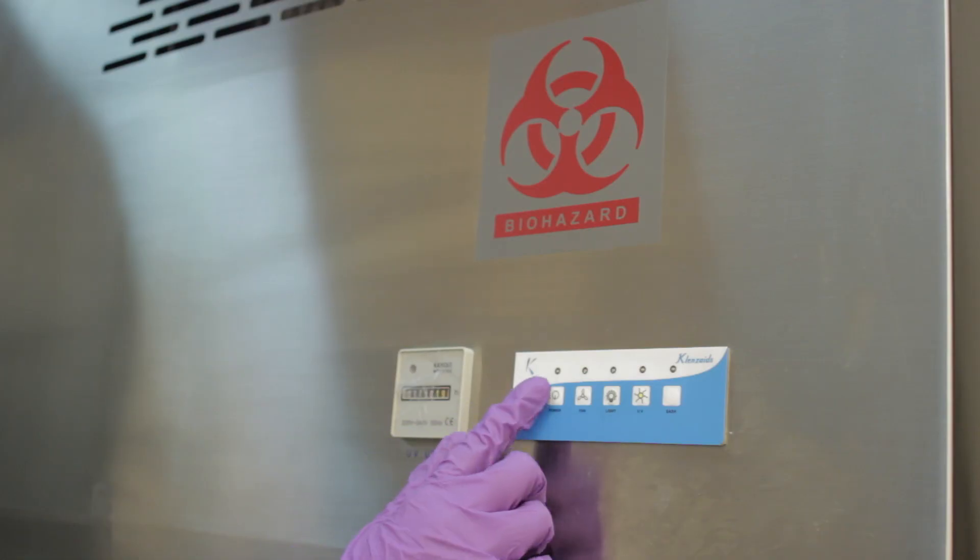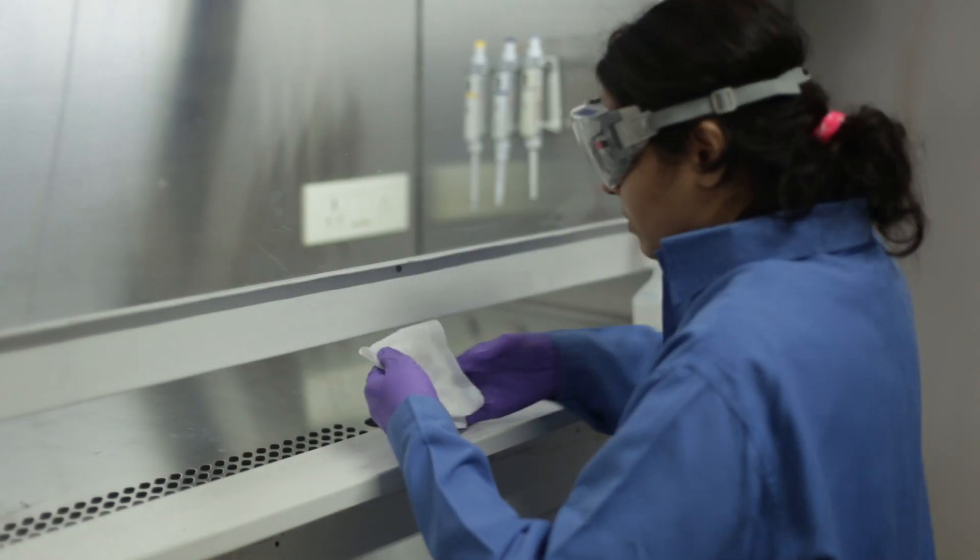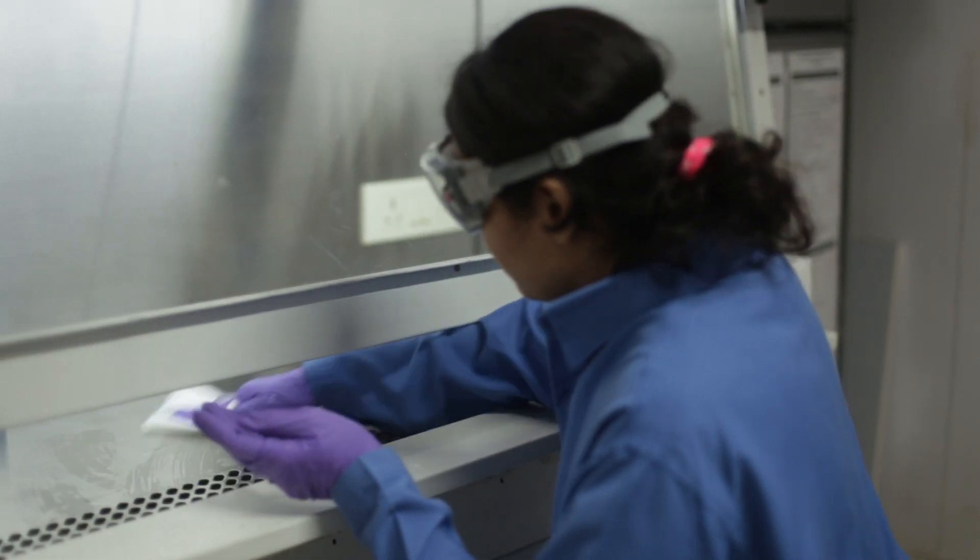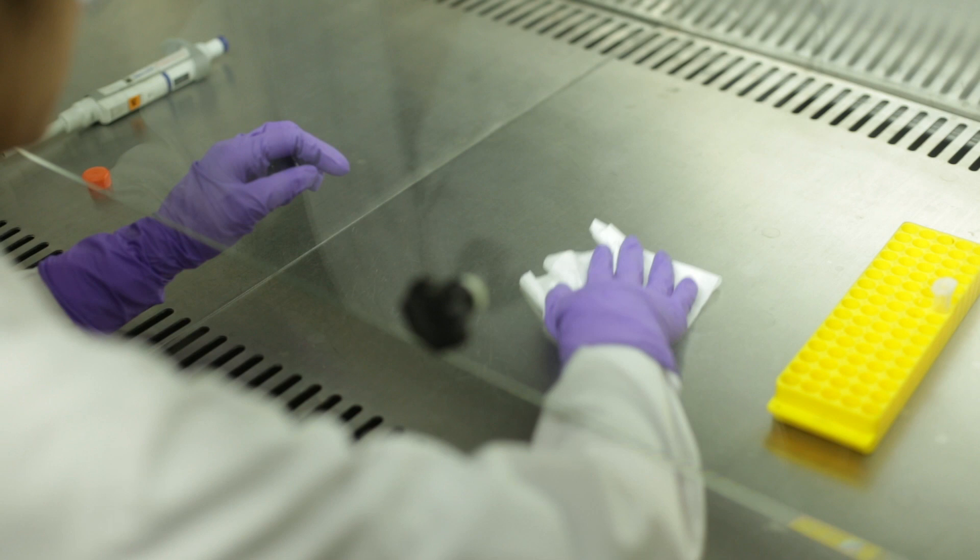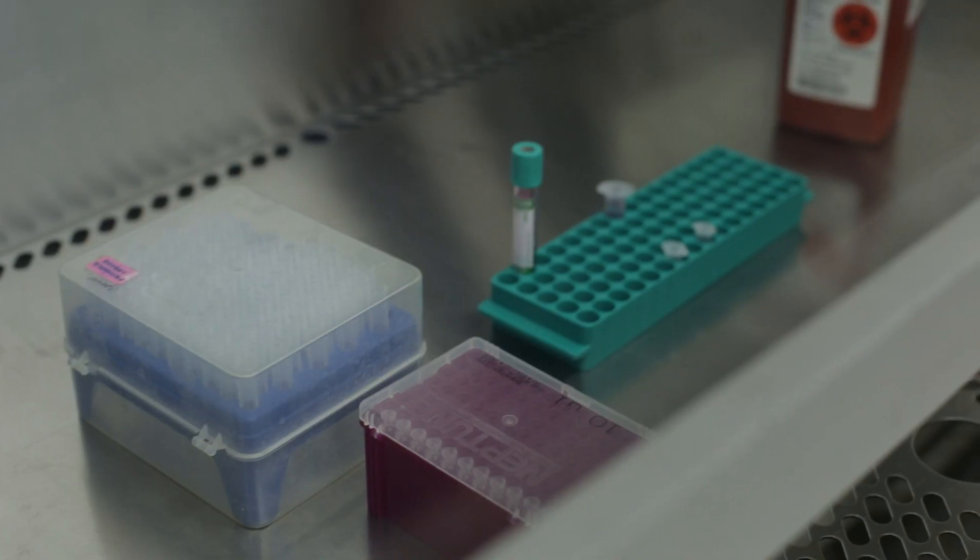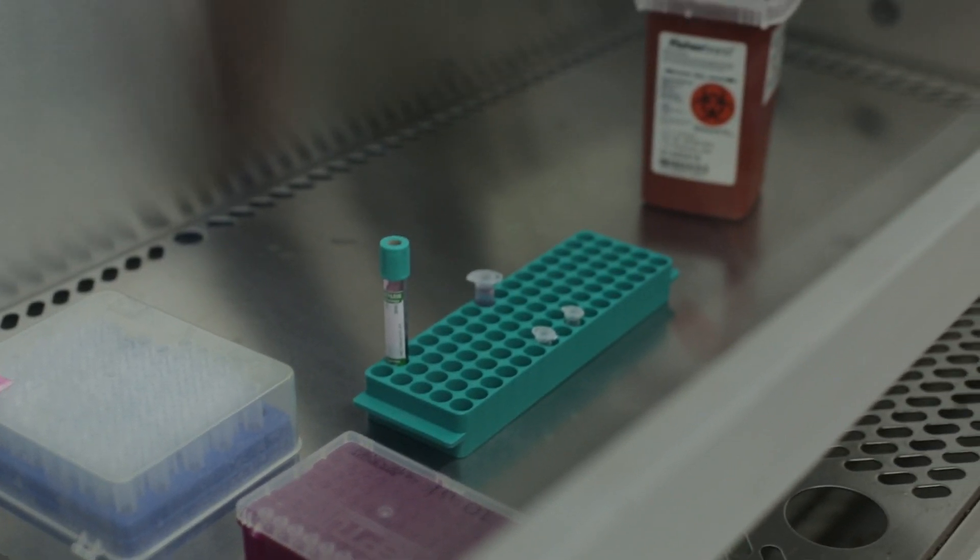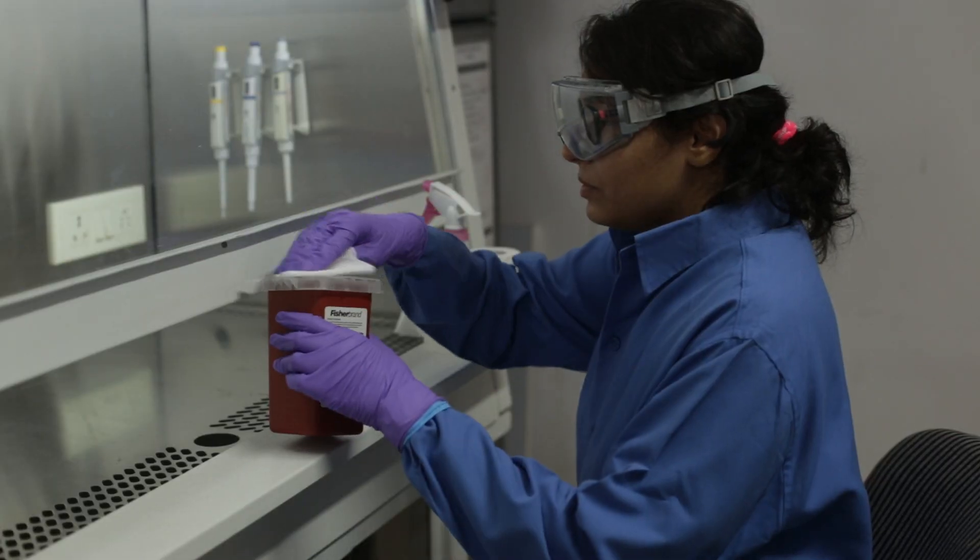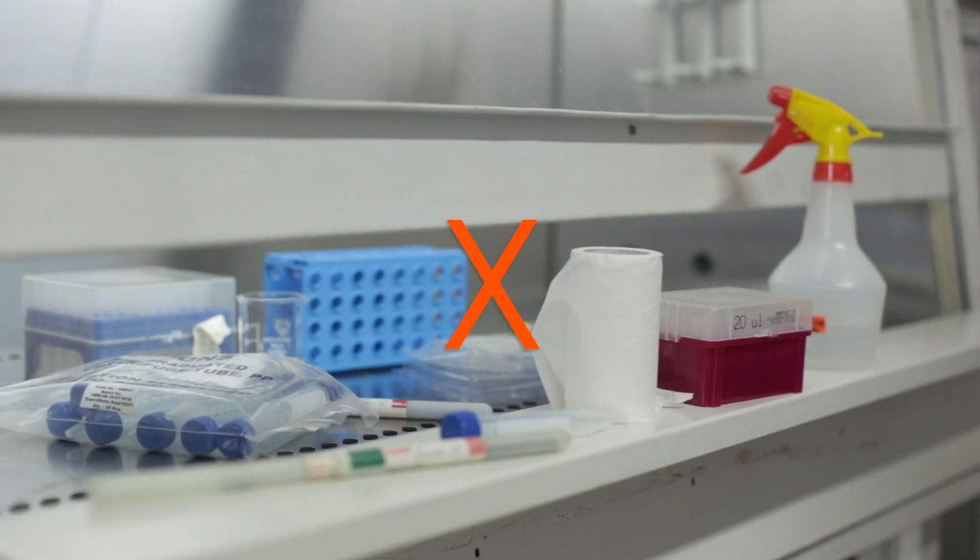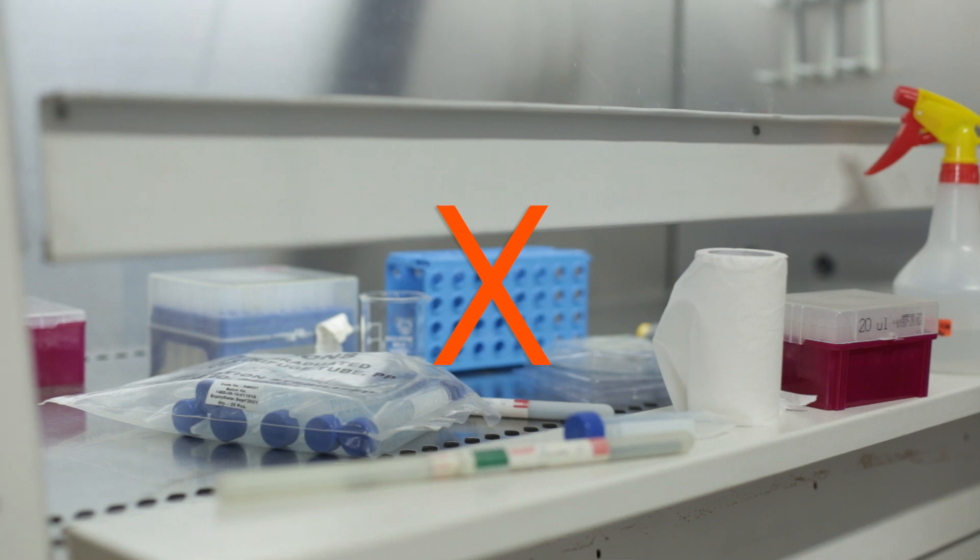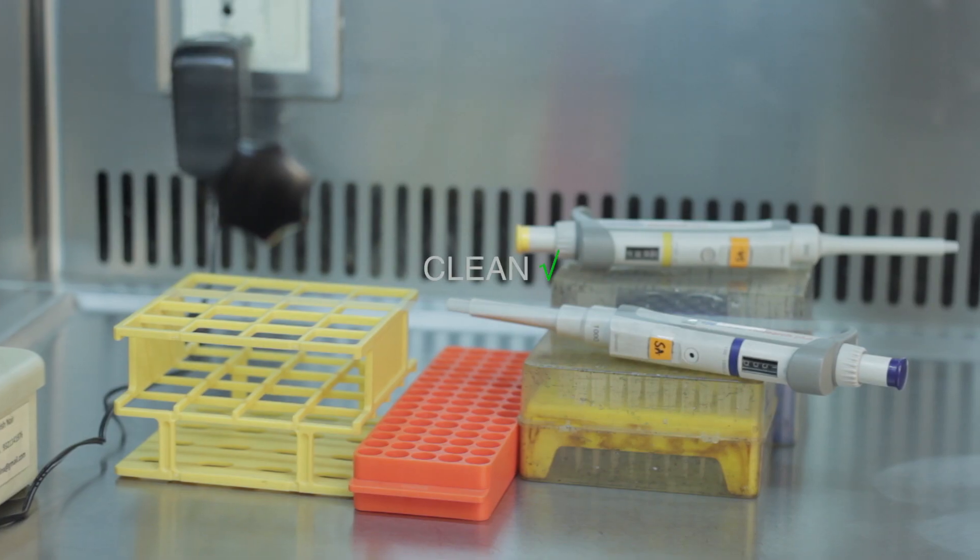Switch on the cabinet at least five minutes before starting the work. Decontaminate the work area before you start working in the biosafety cabinet. Keep all essential items in the cabinet before starting work and make sure that they are decontaminated. Airflow grills must not be obstructed and there must be no cluttering.